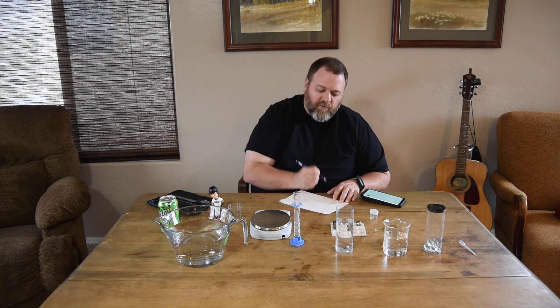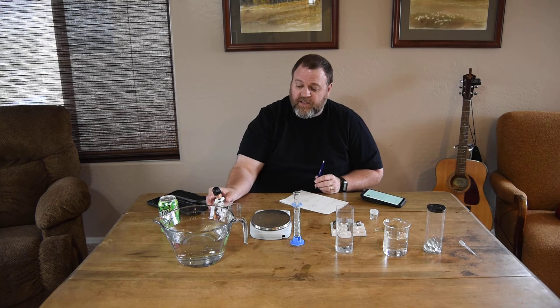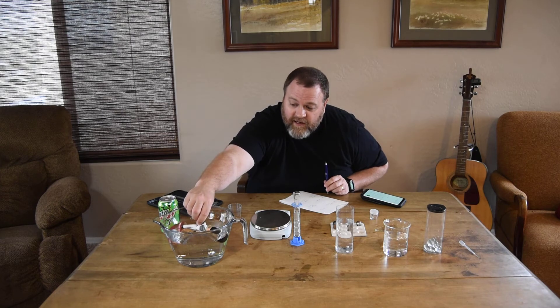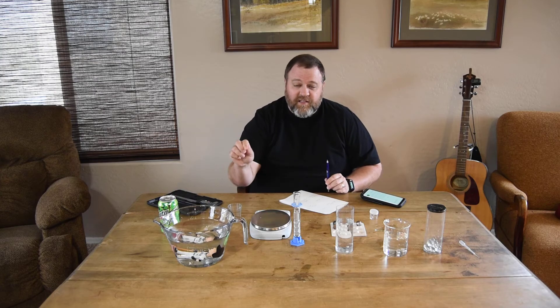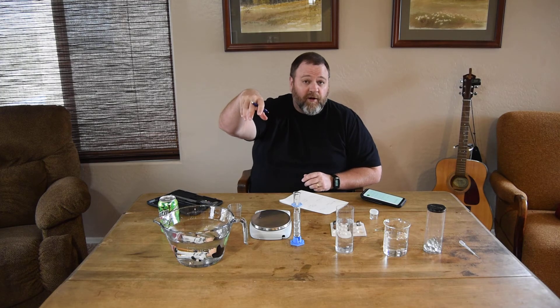If you remember from our earlier video, the density of water is 1 gram per milliliter, so this statue is denser than water at 1.64 grams per milliliter. That makes sense because when I put the object in water it didn't float — it actually sank. Because the statue is denser than water it sank. If the density of the object were less than water it would have floated.